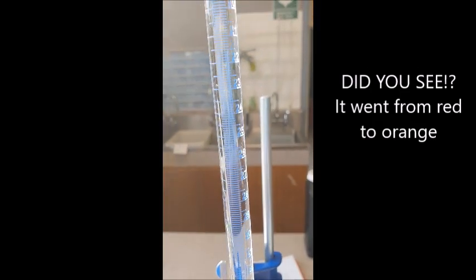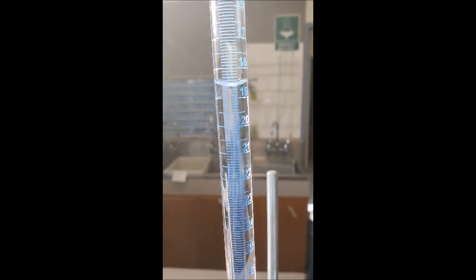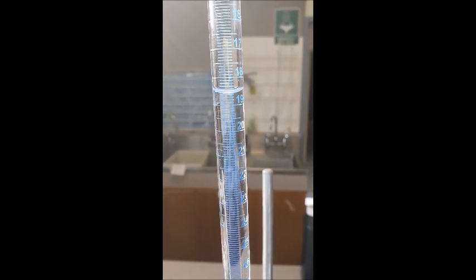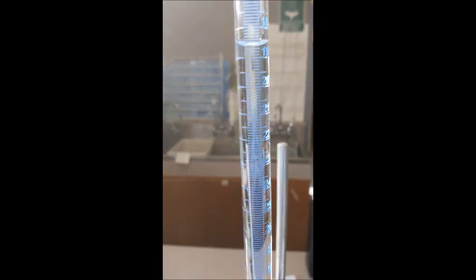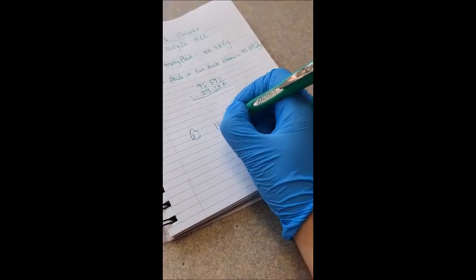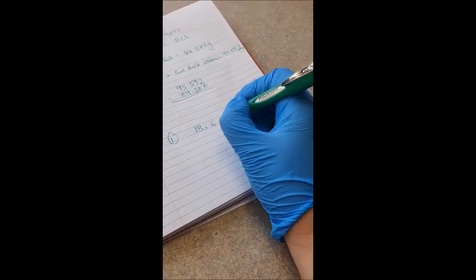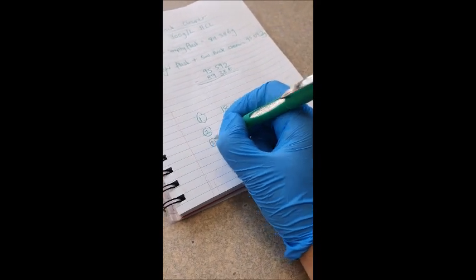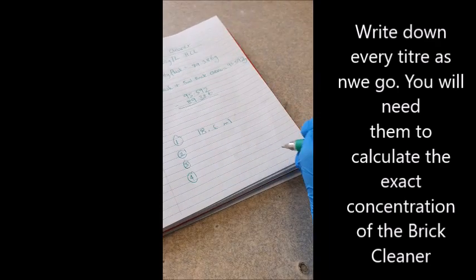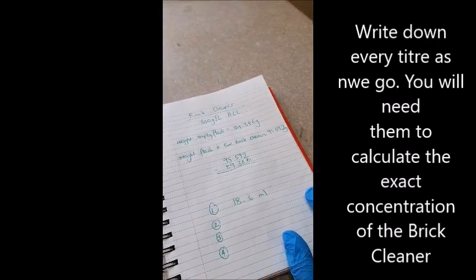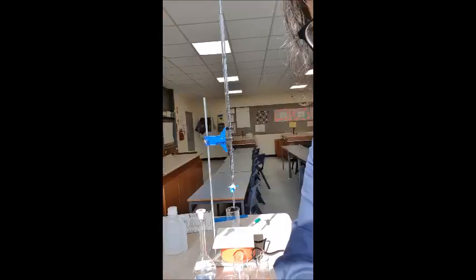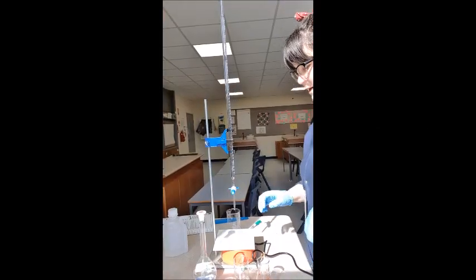Now let's look at how many. So that was 18.6 mil. So you need to write down all of these results and then you can calculate the actual concentration of this brick cleaner.